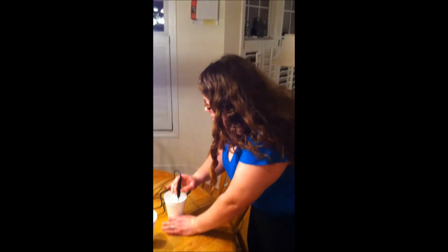All right, good. I'm just going to continue slowly stirring it to make sure the heat is being transferred throughout the entire solution. And how will we know when the reaction is done? Debbie, I saw your hand first. I think that it might level off. The temperature will just kind of level off and stabilize. Okay, so temperature is stabilized because... There won't be any more reaction occurring. All right, so it's not going to be consuming any more heat. All right, and starting to stabilize.